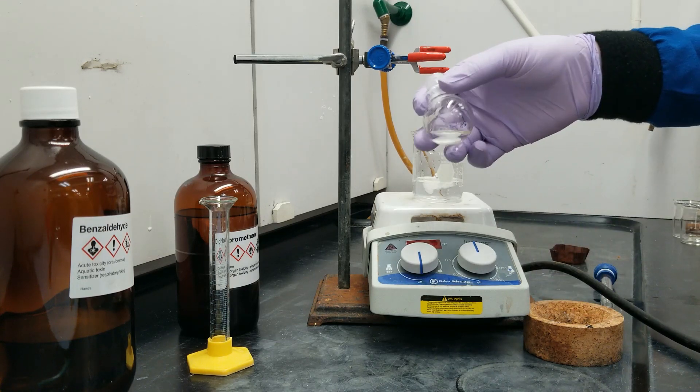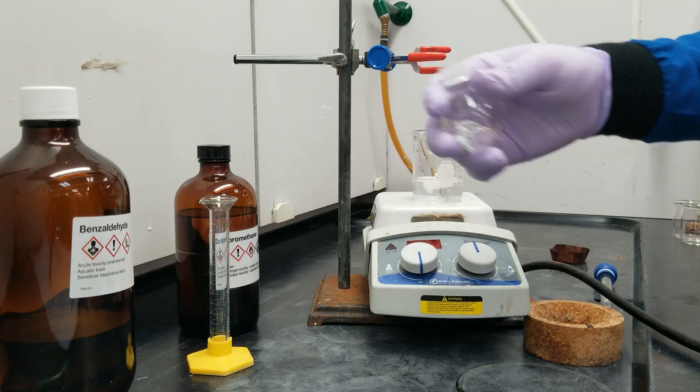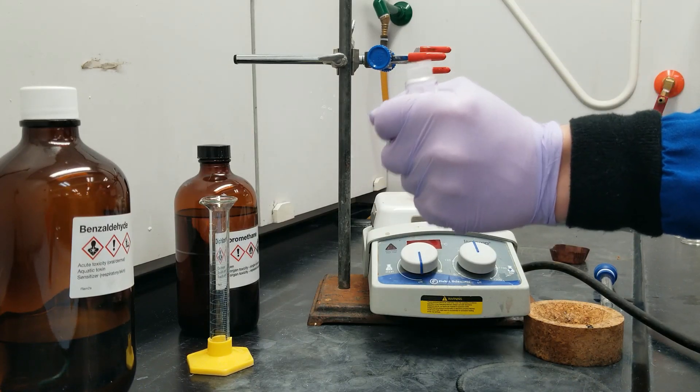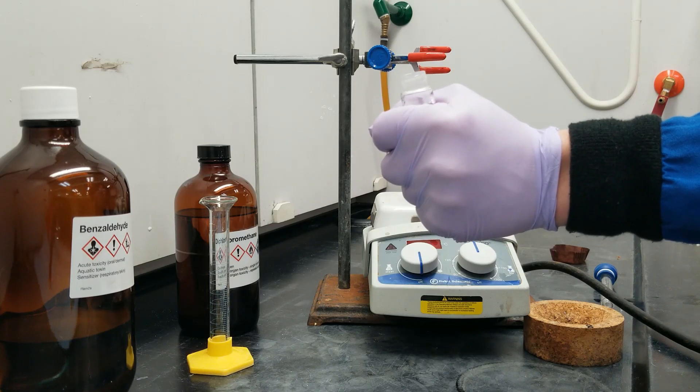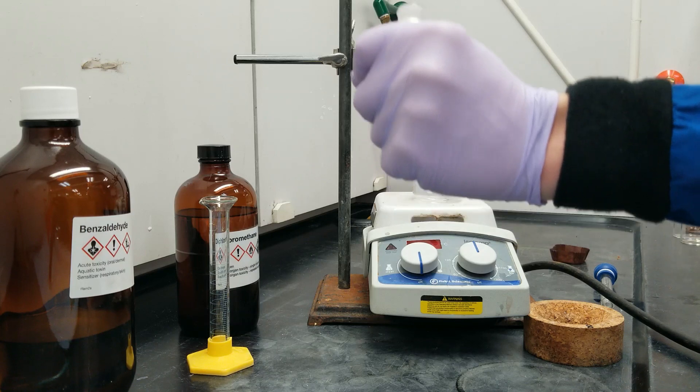I'm going to go ahead and isolate the product by removing the DCM by airstream. And so I'm going to warm it with my hand because the evaporation is going to cool it down rather quickly. I'm going to add a little bit of air into the flask.